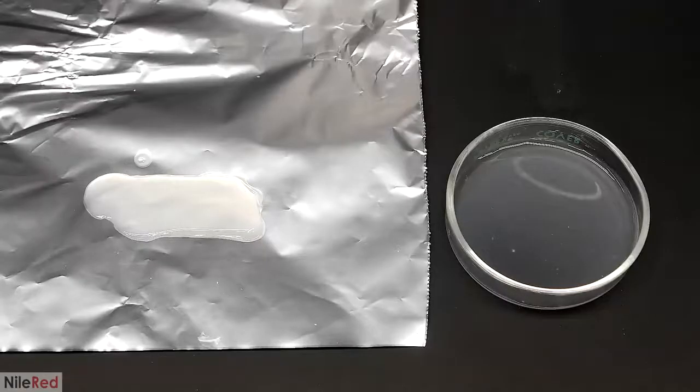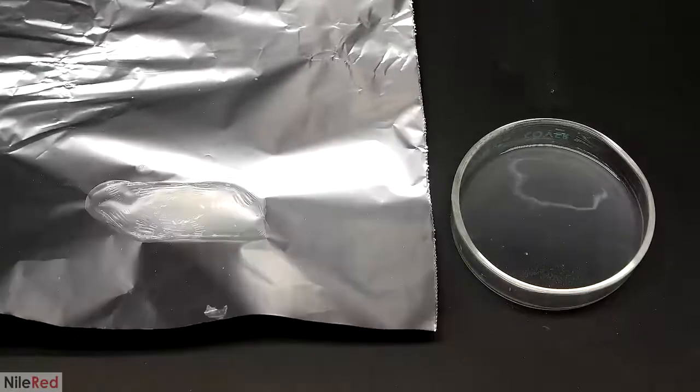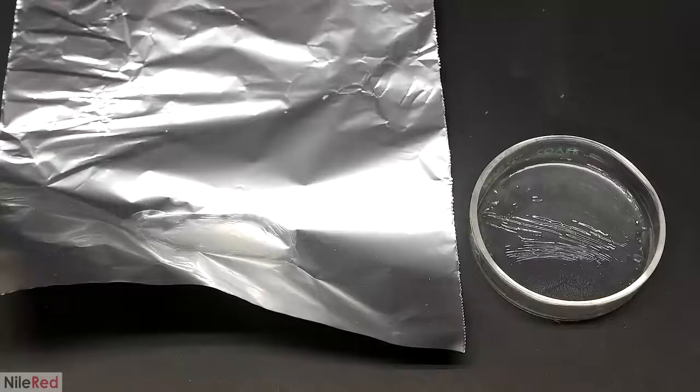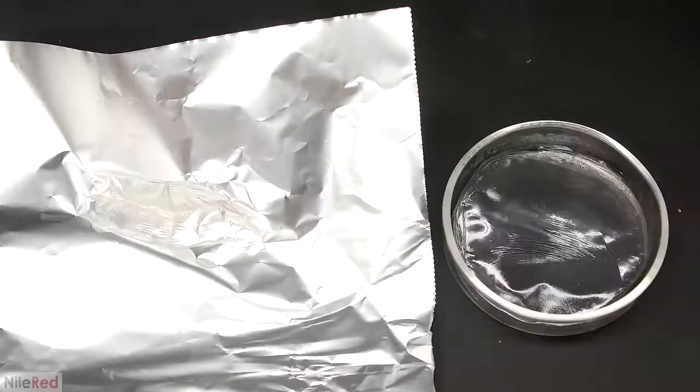Then I just waited for the acetone to evaporate, which took quite a long time. What's kind of interesting was that as it evaporated, the cellulose acetate slowly contracted in on itself. It's happening in both samples, but the aluminum foil one is much more evident. Eventually, the acetone was pretty much gone from both of them, so it's time to check them out.